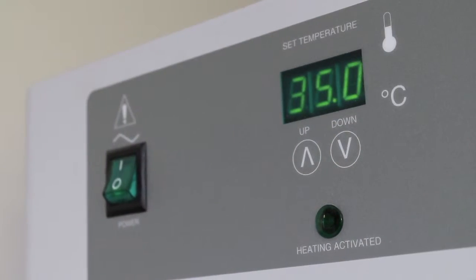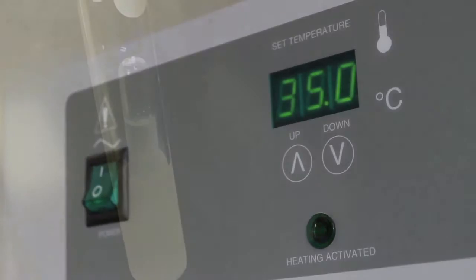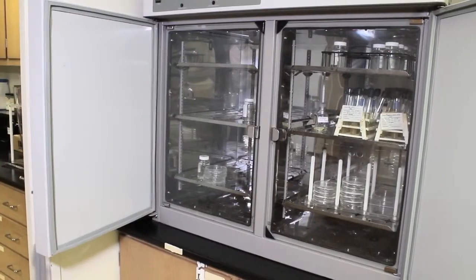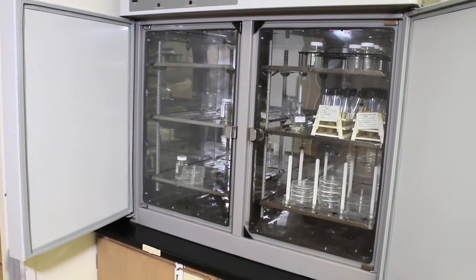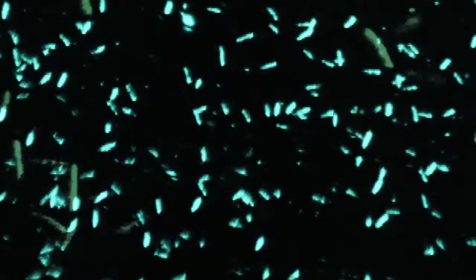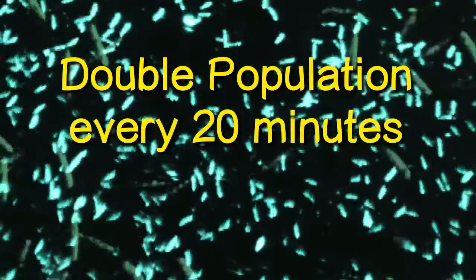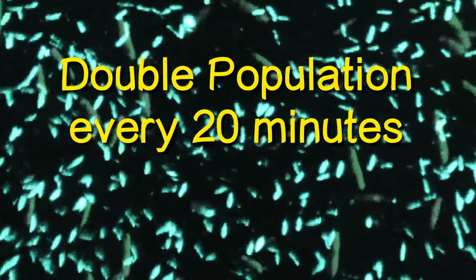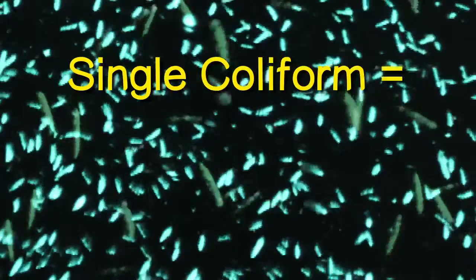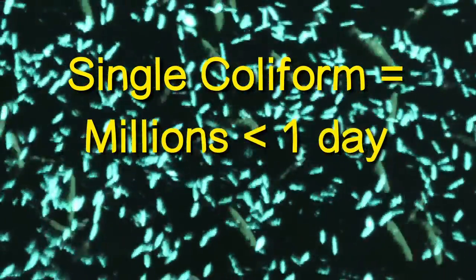The temperature is 35 degrees Celsius, approximately human body temperature. Together with the supply of food and water, the incubator is an ideal growth environment for the coliform bacteria. In this environment, the bacteria will reproduce at a rate so as to double the population every 20 minutes. This means that a single coliform bacterium could give rise to a population of millions in less than a day.